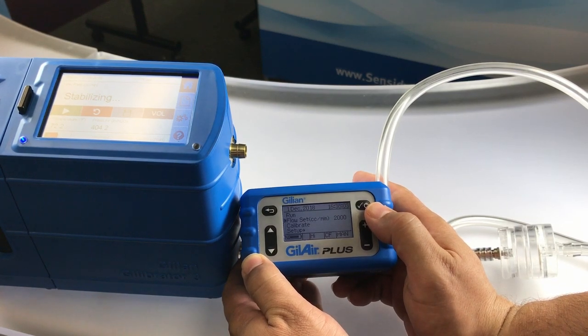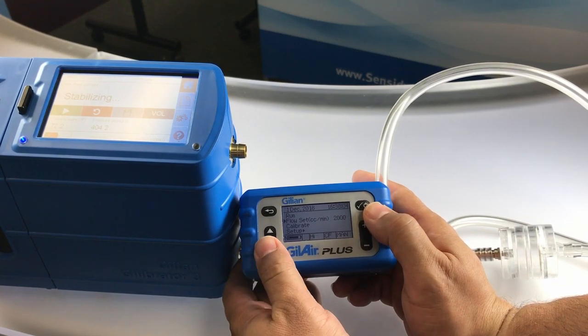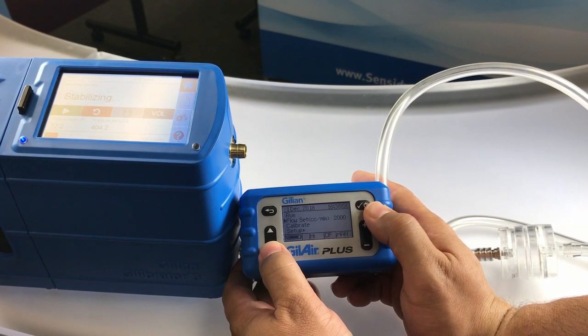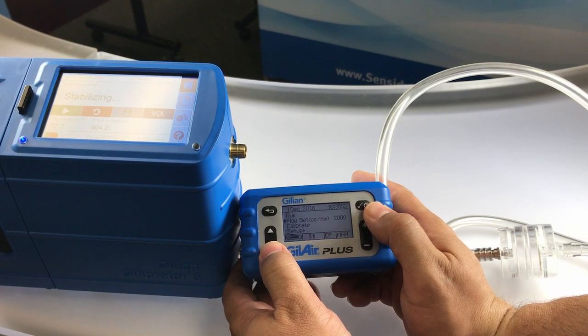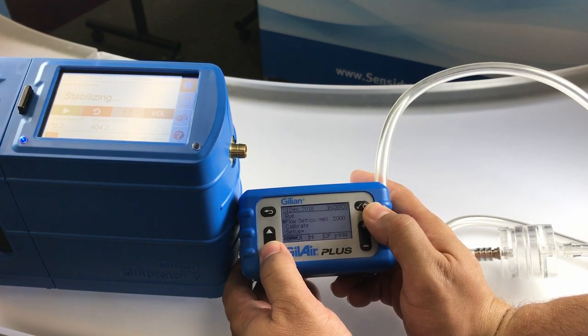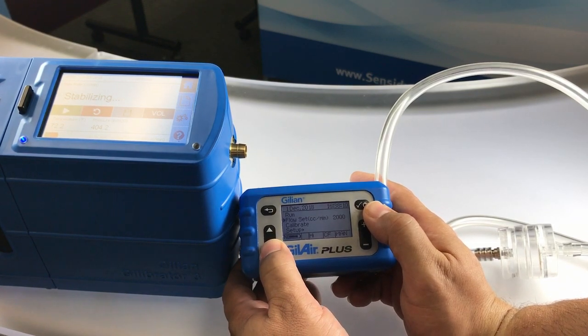I will then arrow down once more to the calibrate option and press the enter button once again. The pump will now begin to run in the calibrate mode.